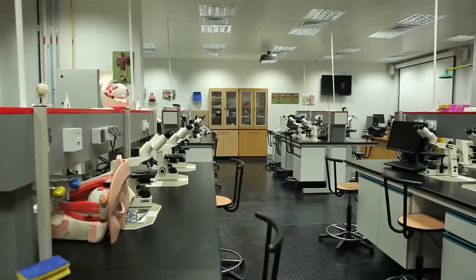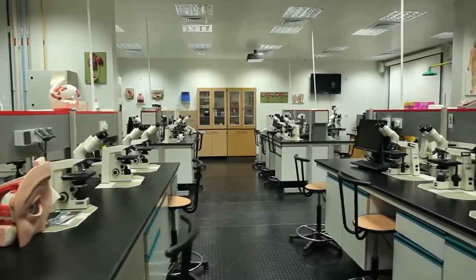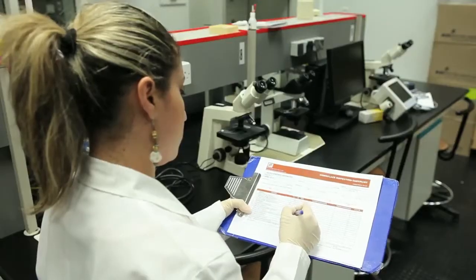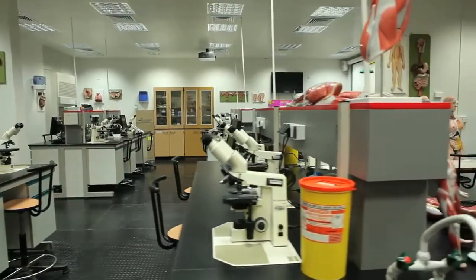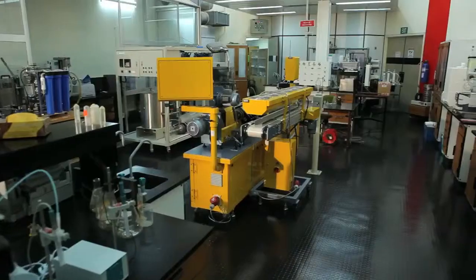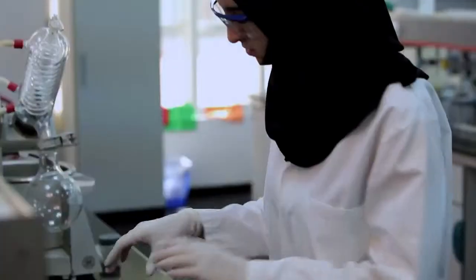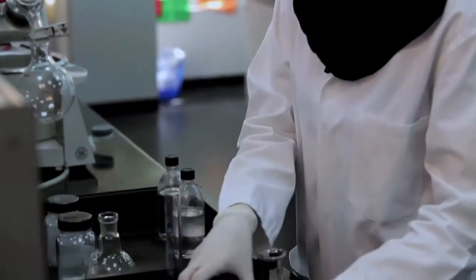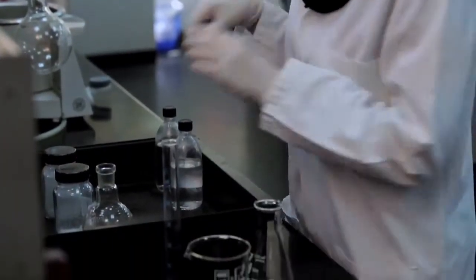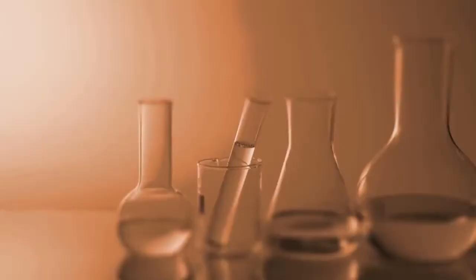Begin by reviewing potential laboratory hazards using the checklist and the laboratory hazard assessment tools. Copies of these documents must be kept in your laboratory manual. Once hazards are identified, proper steps can be taken to mitigate their danger.